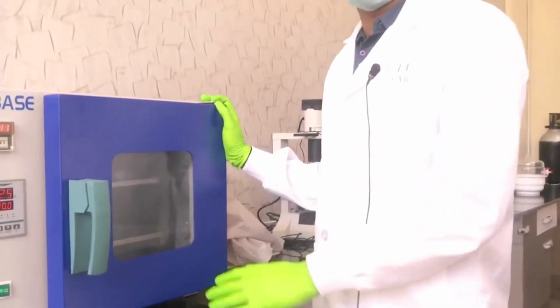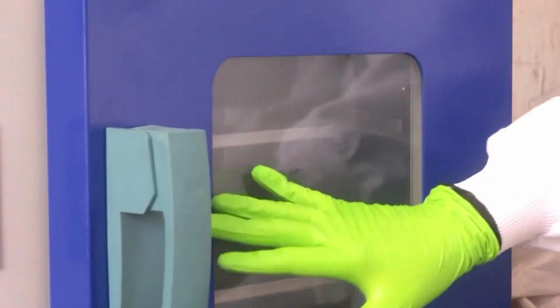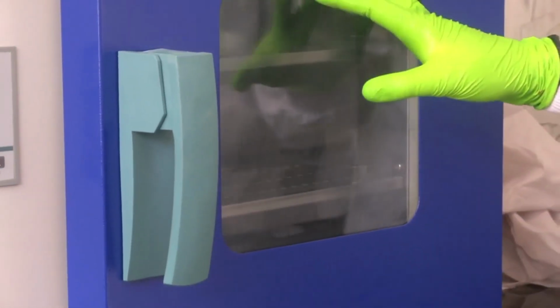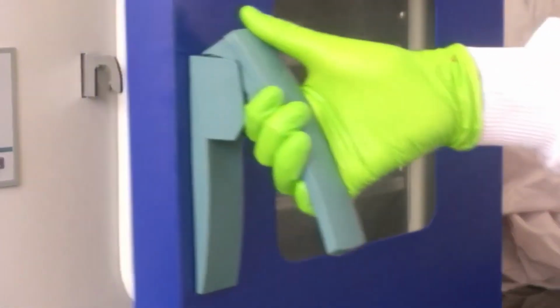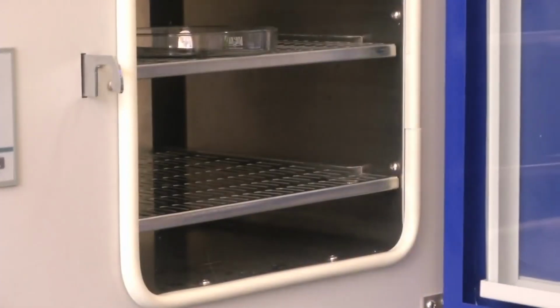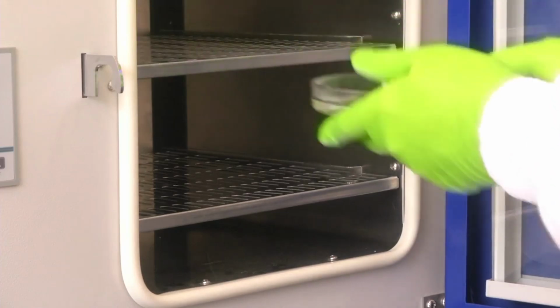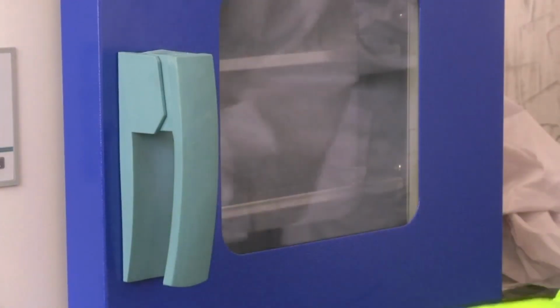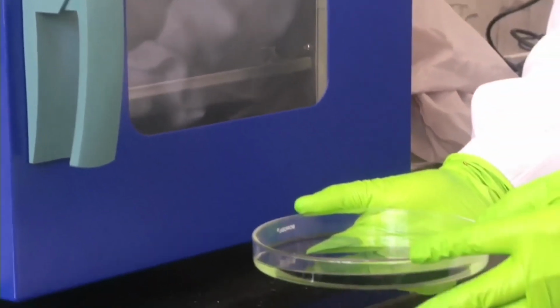So it has been inside the oven for the last 2.5 hours now. By now it would have cured properly. Now we will take out the petri dish that contains the silicon mold and the PDMS on top and see how it has come. So this is the petri dish with the silicon mold and the PDMS.